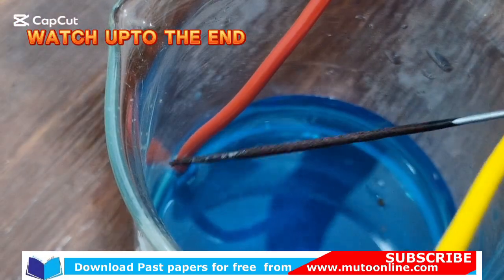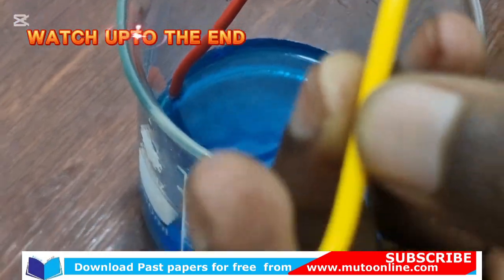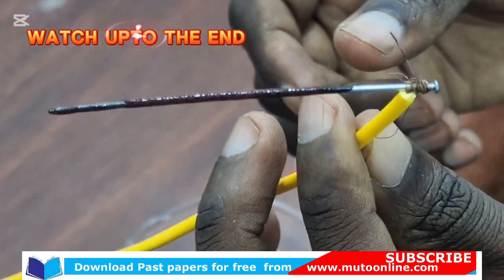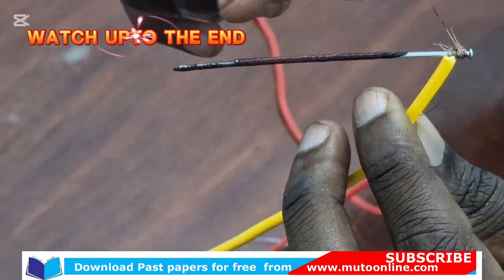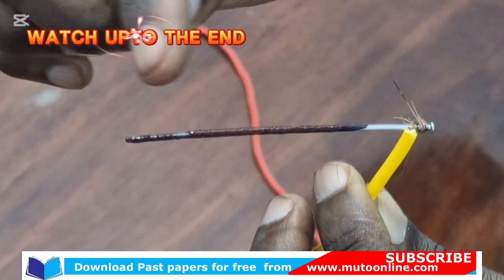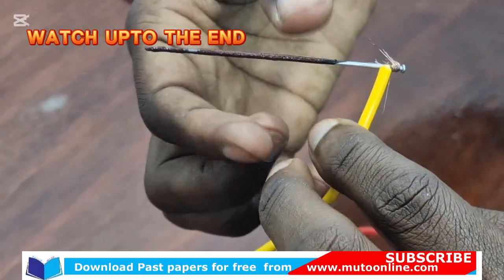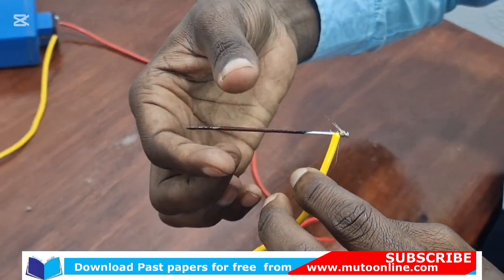We use the pin as our cathode. We can see there is deposition of brown solids around it. We are noticing some increase in the size.